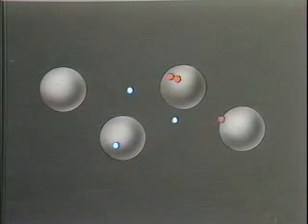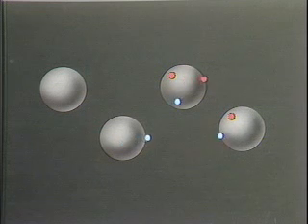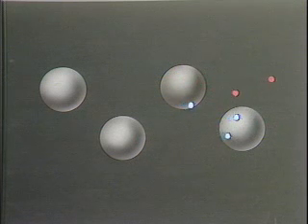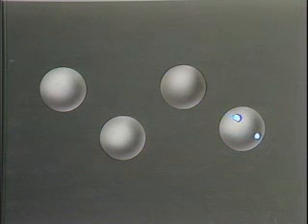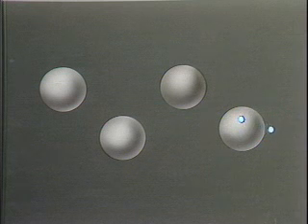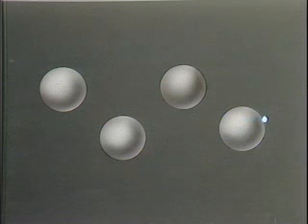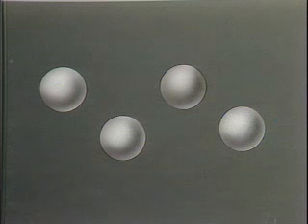However, some of this vapor still also does dissolve to some extent down the column. Each component establishes its own equilibrium between the vapor phase and the stationary phase continuously through the column. Because a component can only move when it is in the vapor phase, the more the equilibrium favors the vapor phase, the faster the component will move through the column. Because of this, slight differences in the equilibrium of the components result in separations.